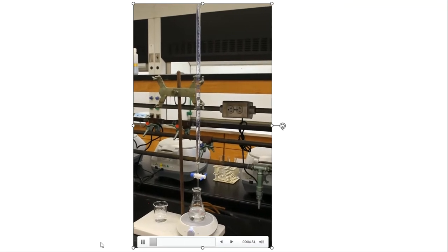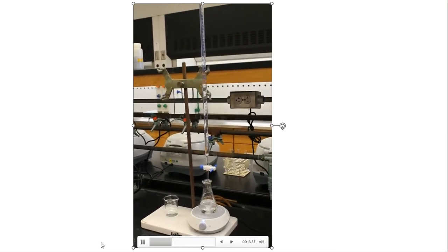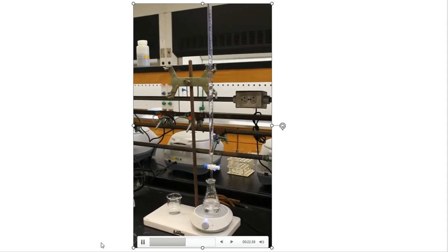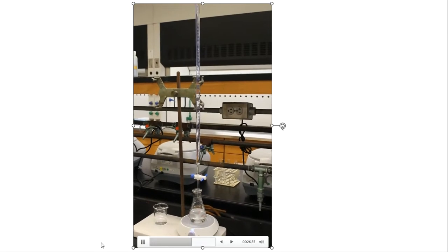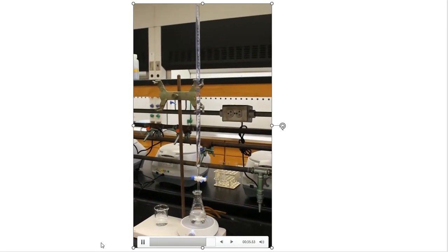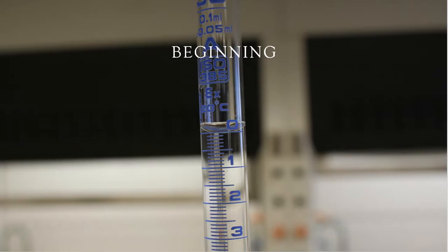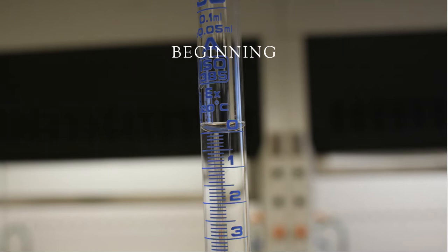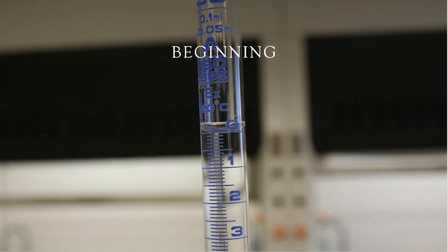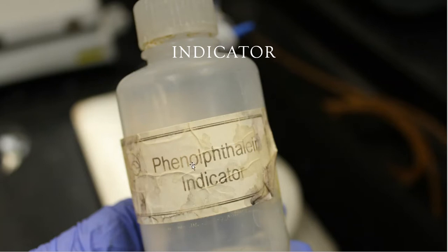Titration does appear in organic chemistry — right here. The bottom Erlenmeyer flask holds the product from the maleic anhydride reaction. The 50 mL burette above contains the titrant. I'll slowly add titrant to the flask containing the product, looking for a traditional pink color change. The titrant is sodium hydroxide. The indicator used is phenolphthalein, which is normally colorless in acidic conditions.